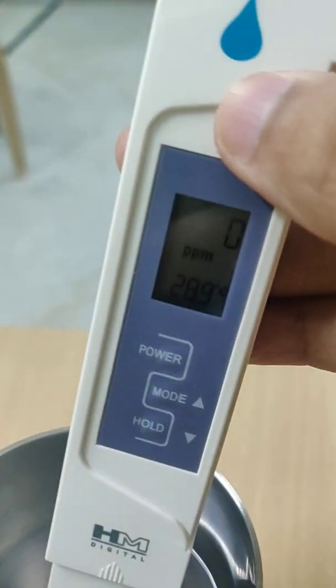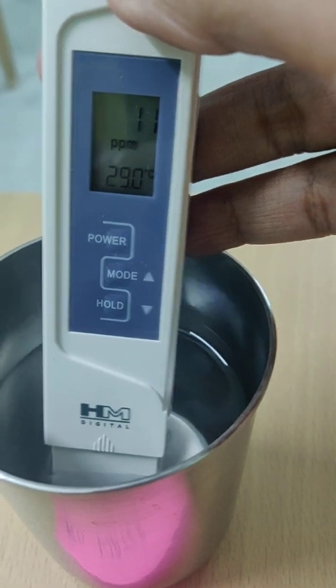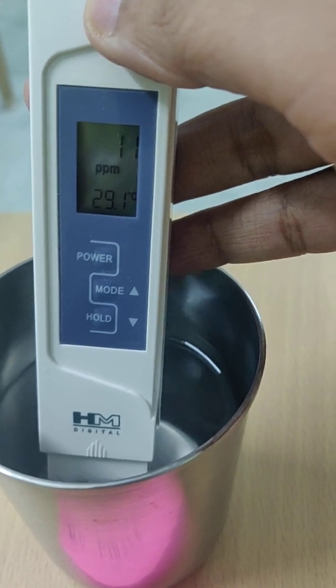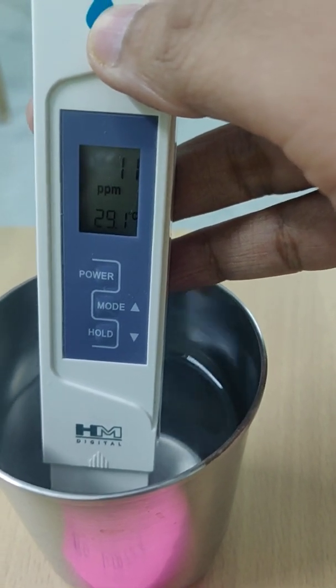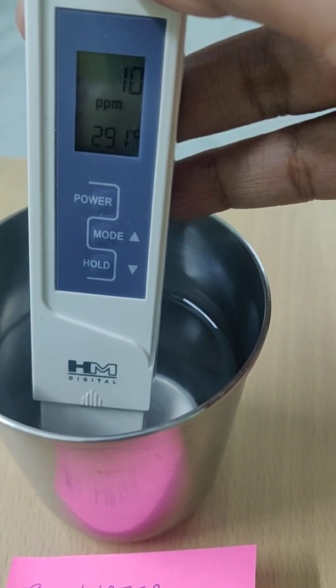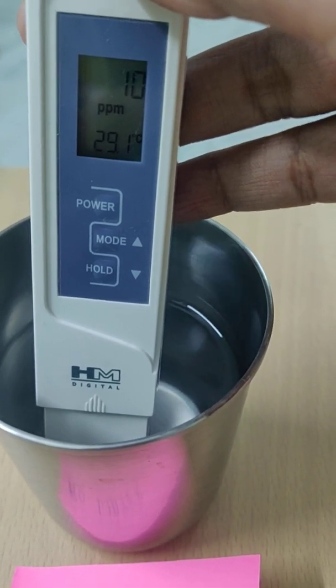And when we use it with the RO water purifier, you can expect very little here. Just like if I'm using it in the RO, if you see here, this is very little actually. It is around 11 to 12. So it is slightly in the not acceptable category, because if you have very few minerals, this will cause damage within your body itself. So when you consume such kind of RO water, the best thing is to slightly add a pinch of salt and a pinch of sugar, just like the composition of ORS, as we say.